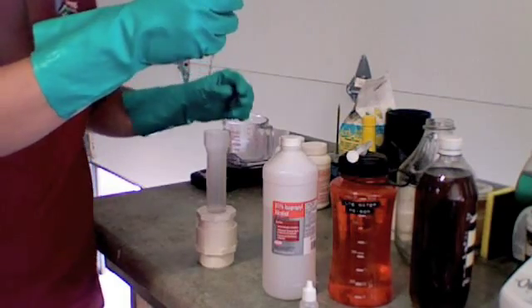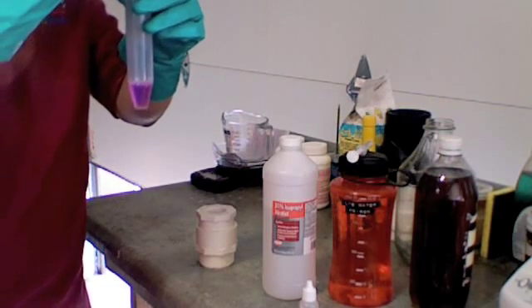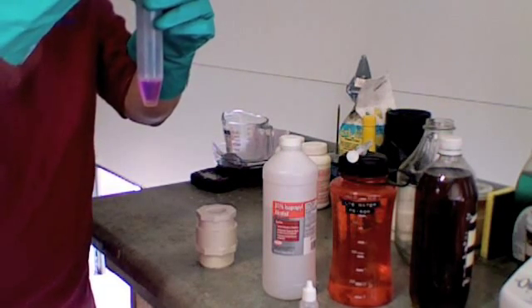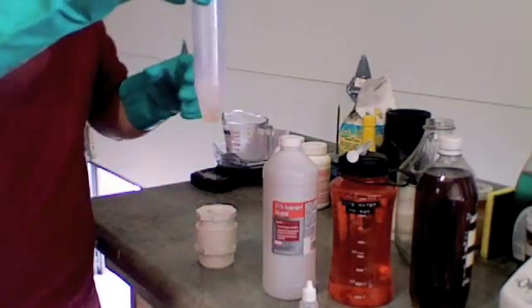Now I'm going to add one milliliter of waste vegetable oil to this solution. And notice as I swirl, the pink color disappears.